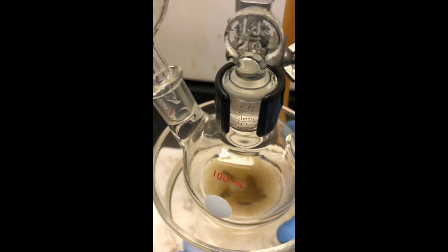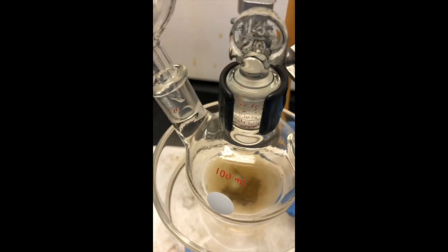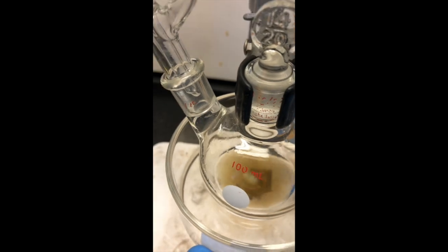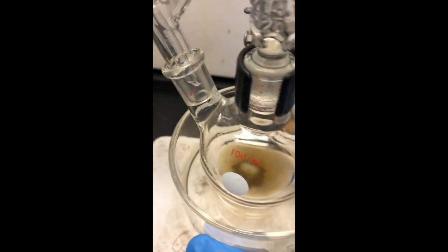If the warm water gets a little cool, we can always add a little more warm water into our bath. Should we go ahead and add the bromobenzene in the extra amount? Yes. Add the rest of this?